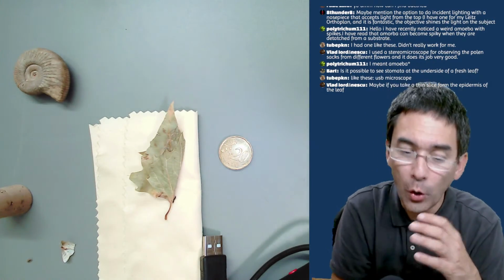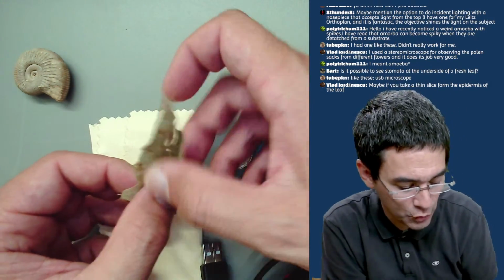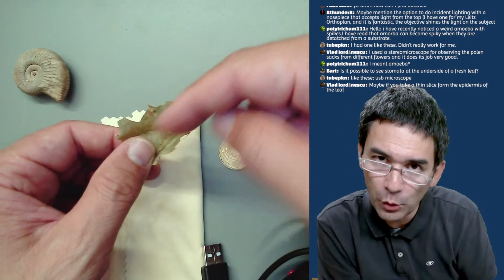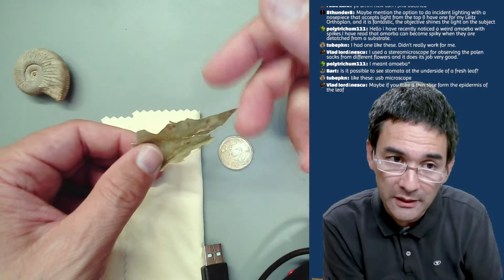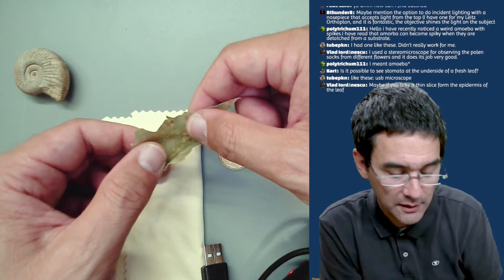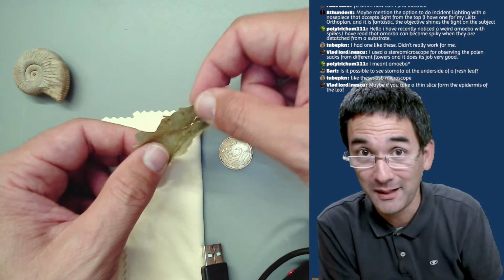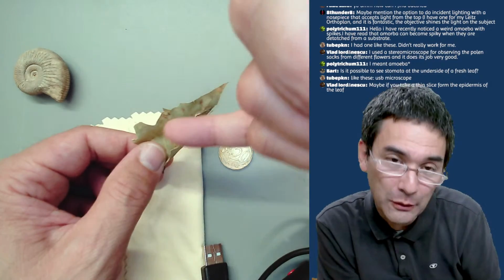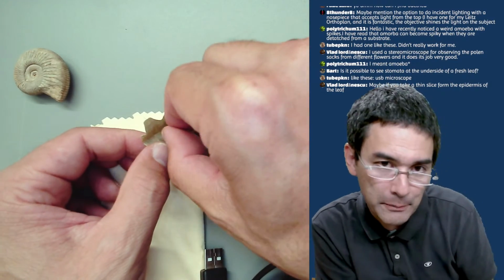Okay, stomates are openings. Maybe I should explain this. This is a bad example here because the leaf is dry. But on the bottom side of a leaf, there are little openings. And those openings are there so that the oxygen can go out and carbon dioxide can go in for photosynthesis. And these openings can be made visible. And that's maybe, again, a topic for another live stream, by putting glue on the leaf, allowing the glue to dry and then peeling it off.